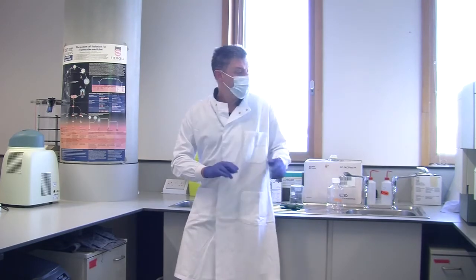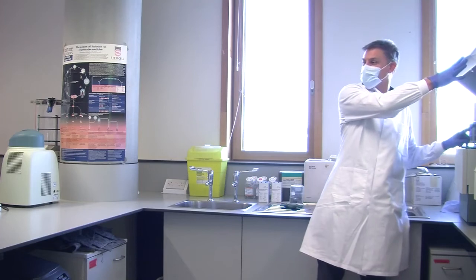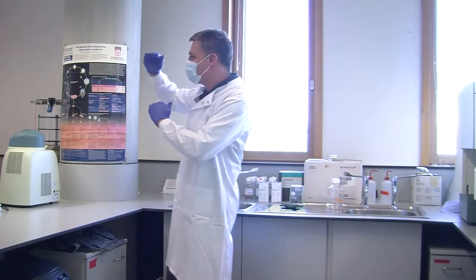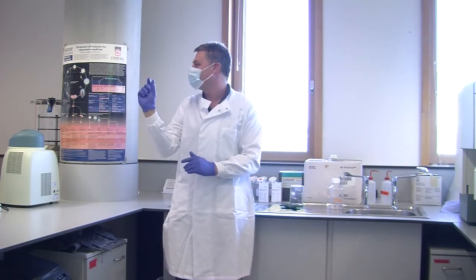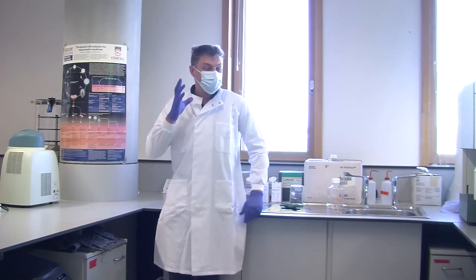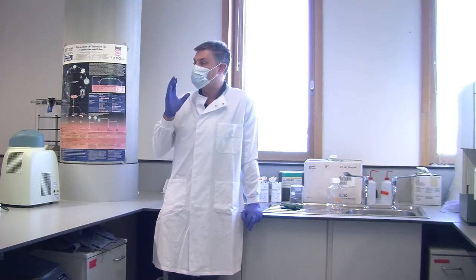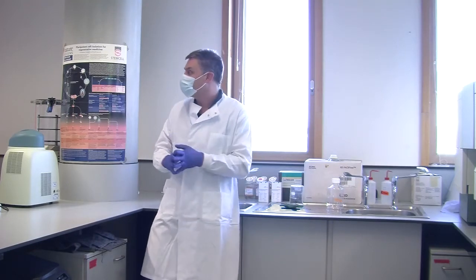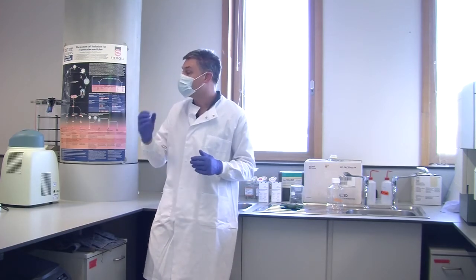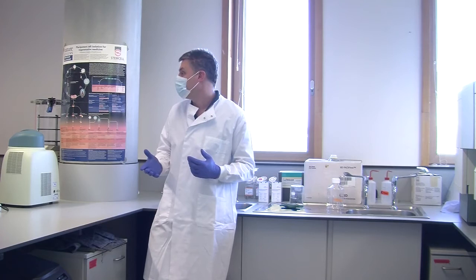And are smaller. I will show you, but the laser in this one is this box here. Okay, I'll show you properly. But the laser in this one is in a box about this big that produces loads of heat. Modern lasers are about this big and produce no heat because they're all LEDs. So there have been advances in technology, but this is the technique that is probably the most common technique in a biological lab. More people do flow cytometry probably than any other single technique, simply because you get a huge amount of data with a cell-by-cell analysis.